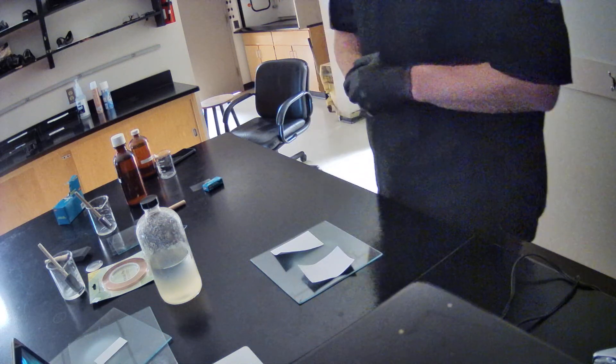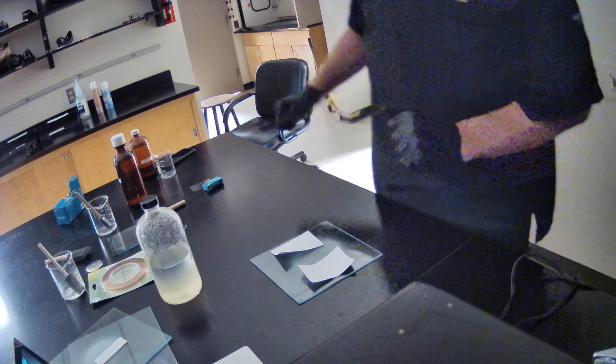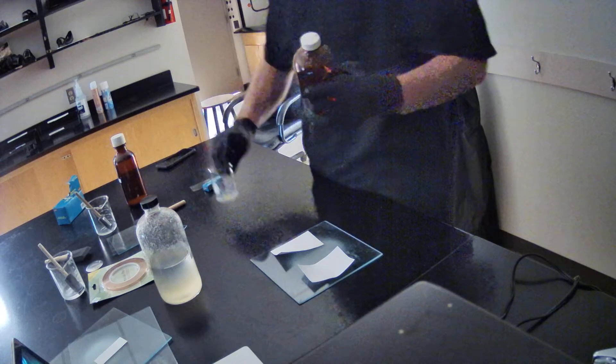Alright, so now we're going to - the lights in the room are dim, and I know it makes it a little challenging to see, but we're going to take now our silver nitrate solution.